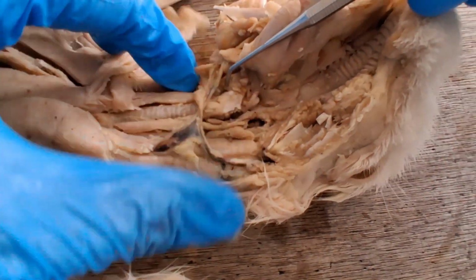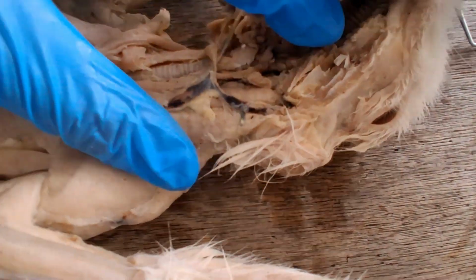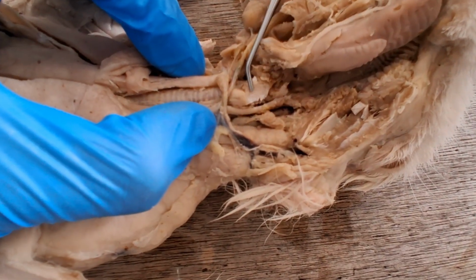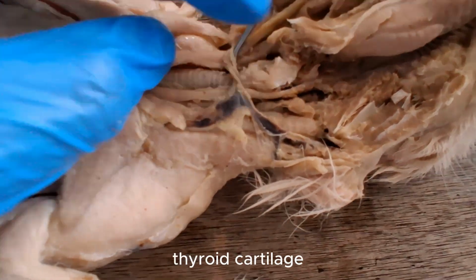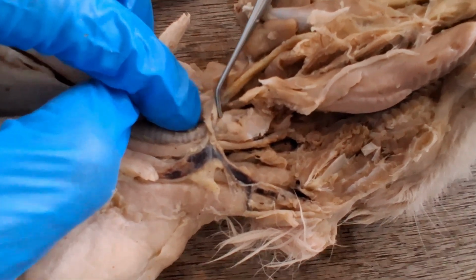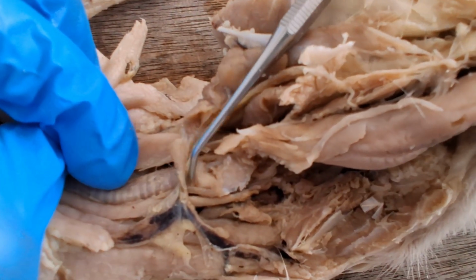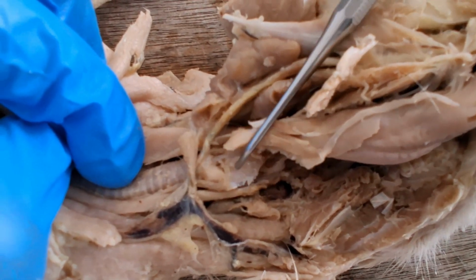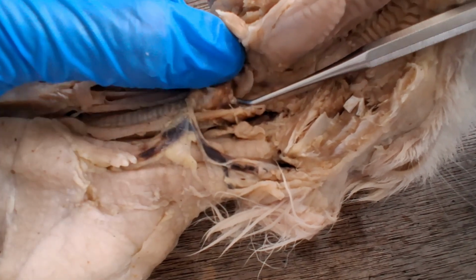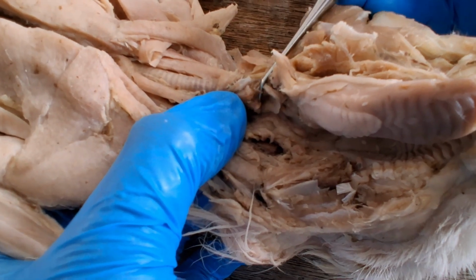The voice box region, or the larynx, is this region here, equipped with cartilages, the largest of which is your Adam's apple, the thyroid cartilage. And then below it is a ring-shaped cartilage, the cricoid. Cricoid cartilage, thyroid cartilage, trachea. On the back side of the glottis are paired cartilages. These are the arytenoid cartilages.